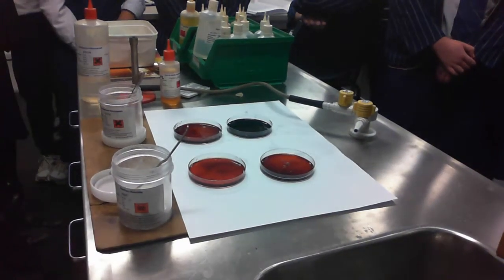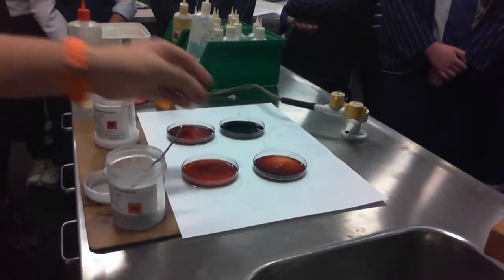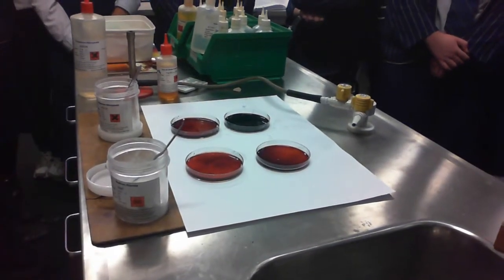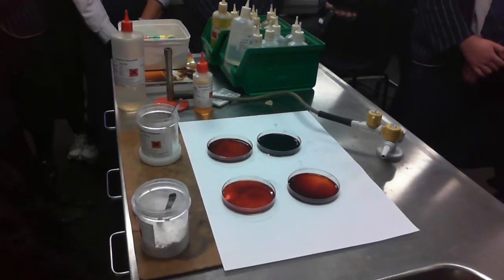So again, like in the first one, not quite so dramatic because we're using a solid rather than a solution. But again, we're seeing that the forward reaction is favoured, because if I add more of the reagent, the thiocyanate, it's favouring the forward reaction. Now, last one's a bit of a weird one. What's the chemical we're adding here?